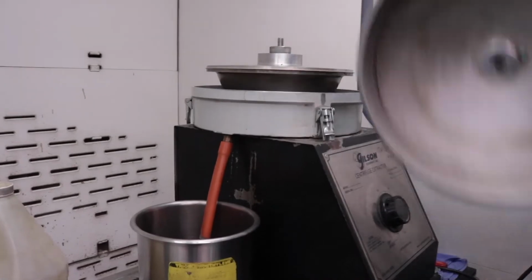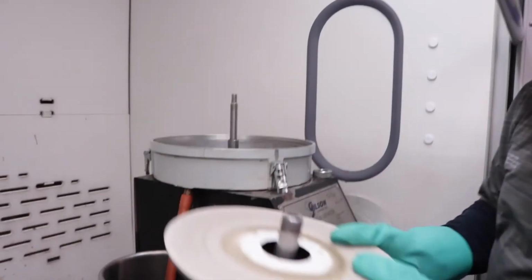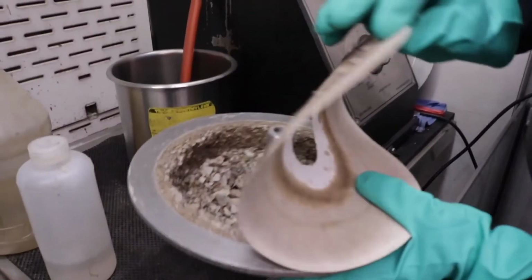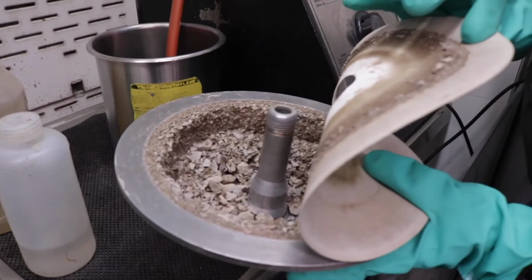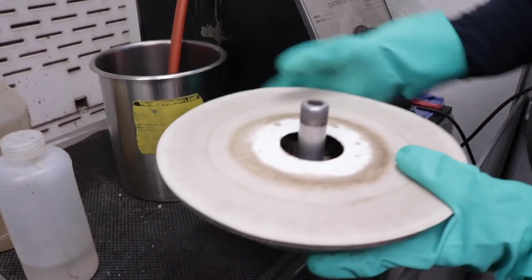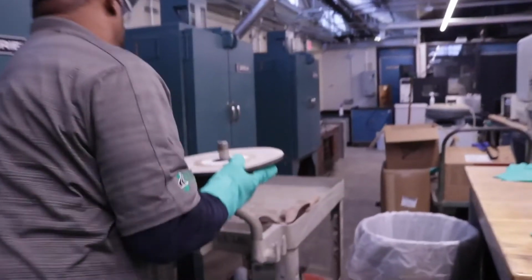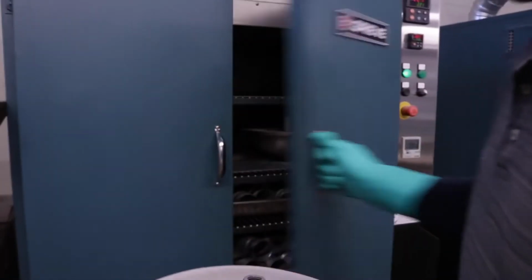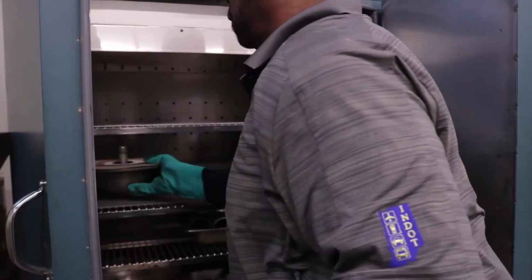After you receive that straw color, you take the lid off. You remove the bowl out of the extractor and you take a look at it to make sure that you get a good clean rinse and there's no conglomerates in the mix. If there were conglomerates, you would have to re-add solvent and let it soak for a little while longer. But we had a clean rinse there.